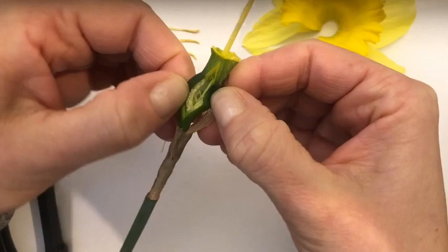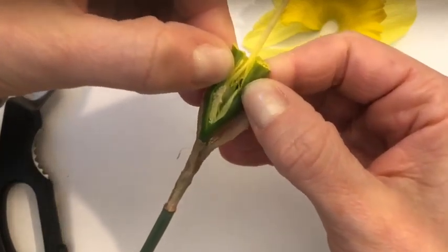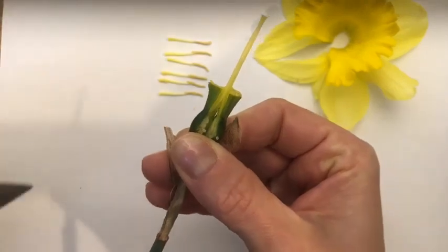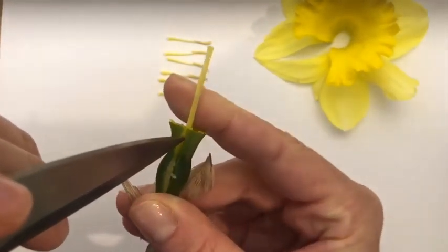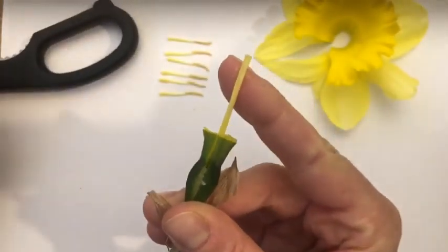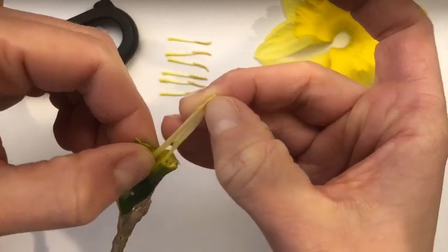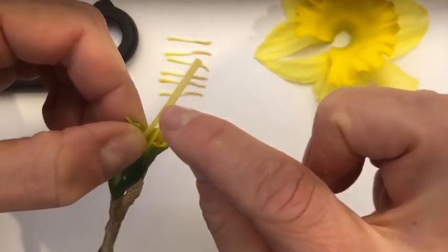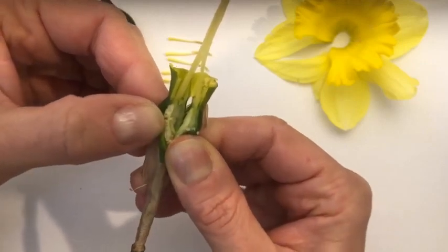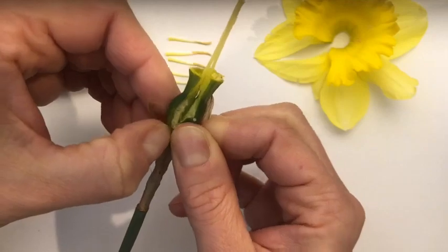You can see eggs — those are called ovules, and those are the female reproductive cells of this flower. I'm going to go ahead and slice up my style and split it in half. What happens during pollination is pollen gets on the tip of the female reproductive organ — the stigma — and it travels down the style into the ovary. When pollen meets these little ovules, that's called fertilization. Each one of these tiny little eggs can become fertilized and become a seed, and if that happens then we can have more daffodils.